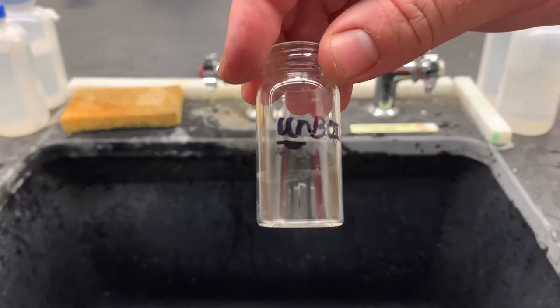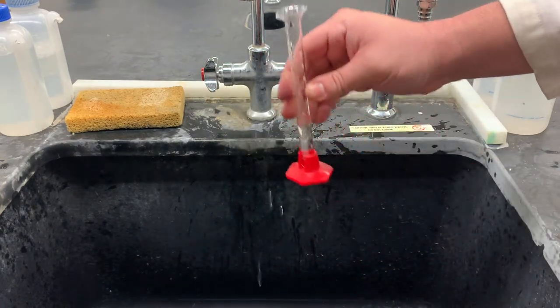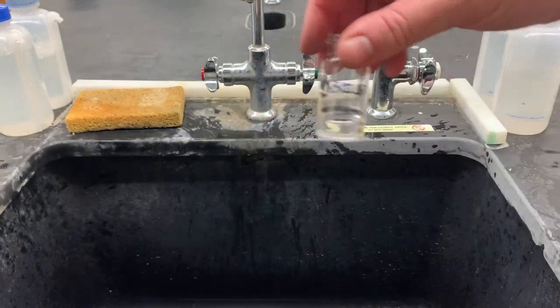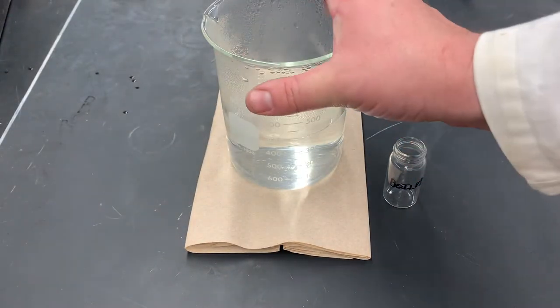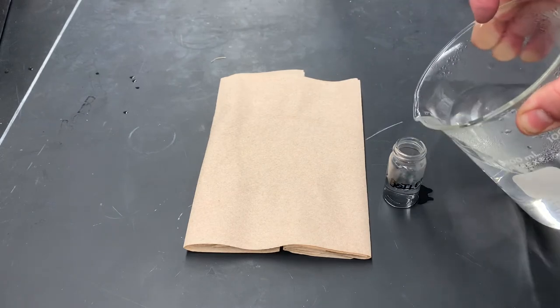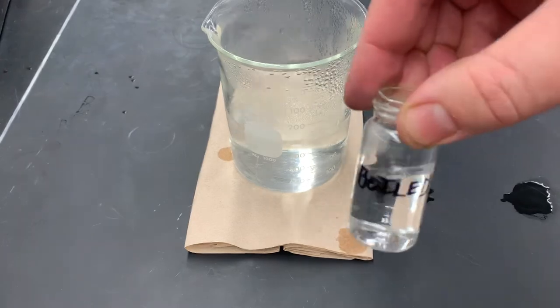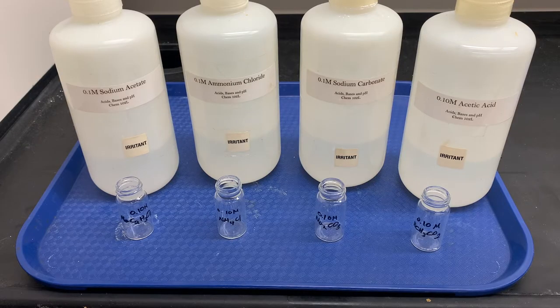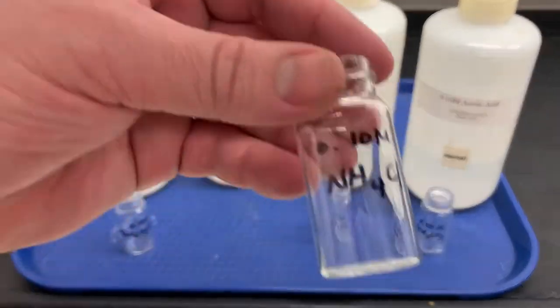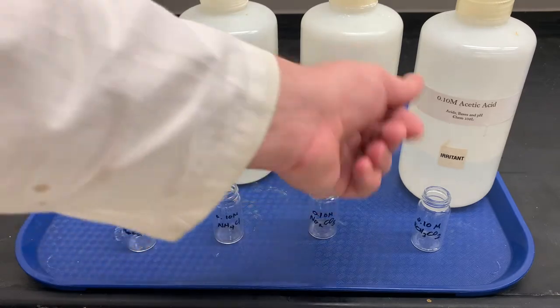The first thing we're going to need is some unboiled water — about five mils worth. We'll also need some of each of these: the sodium acetate, the ammonium chloride, sodium carbonate, and acetic acid.